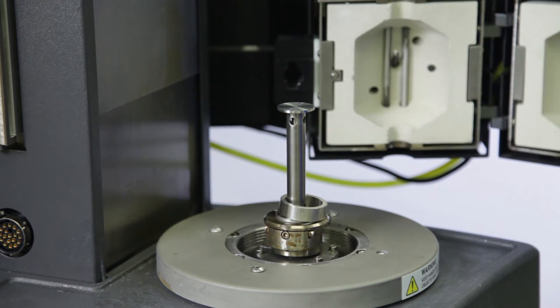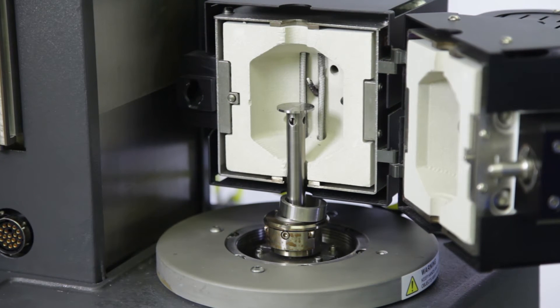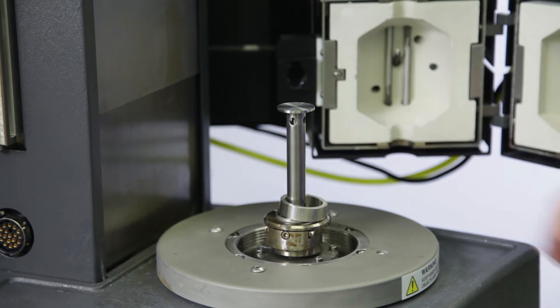Verify the FCO height with the melt ring dropped to the bottom of the lower geometry. If it closes without contacting the ring, then it's ready to go without further adjustments. Remove the ring.